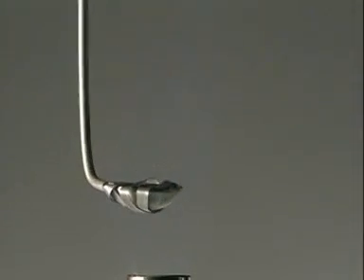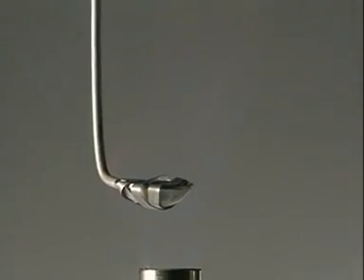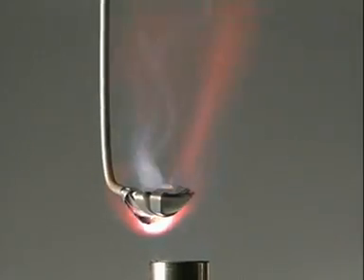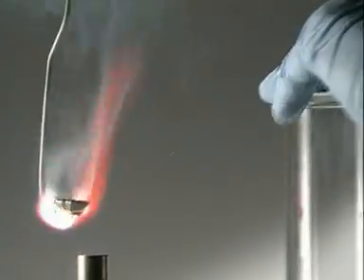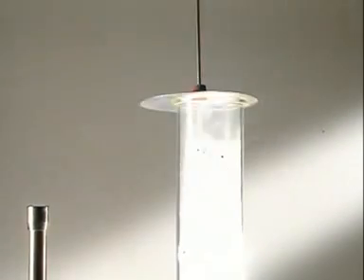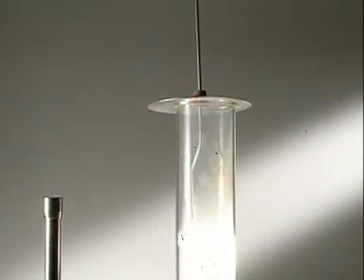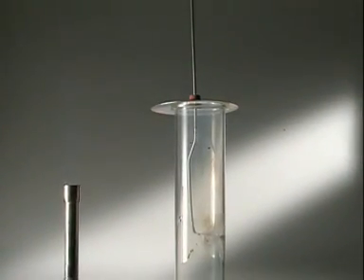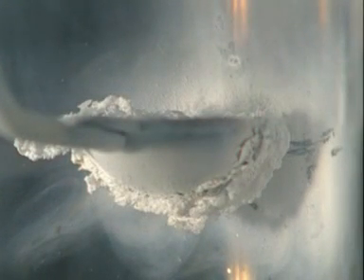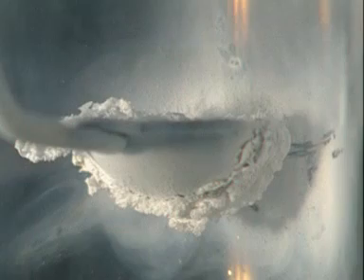Another reactive metal is magnesium. It burns in air with a bright light. Add it to oxygen and it burns spectacularly. The white powder that forms is magnesium oxide.